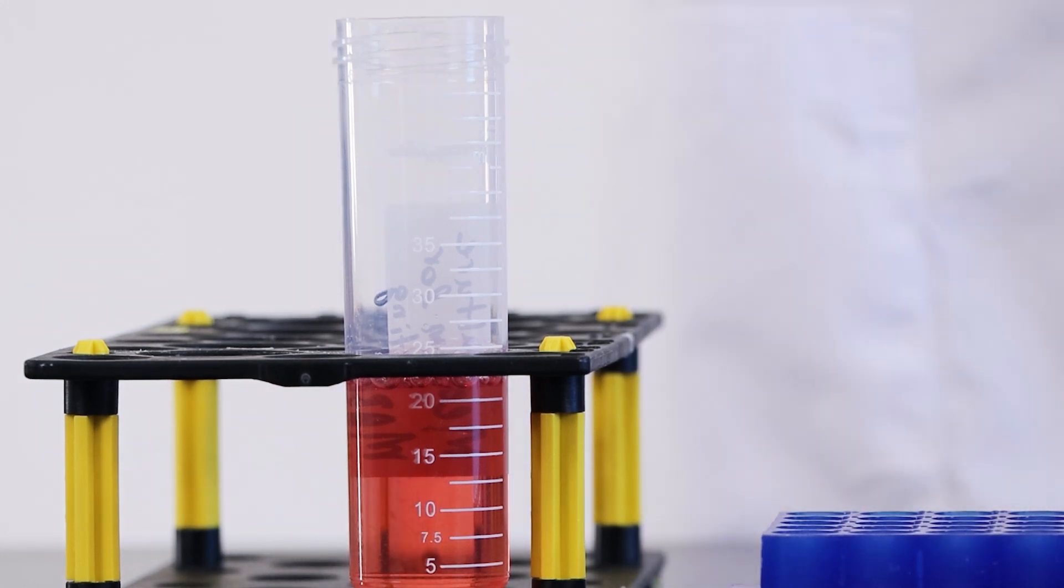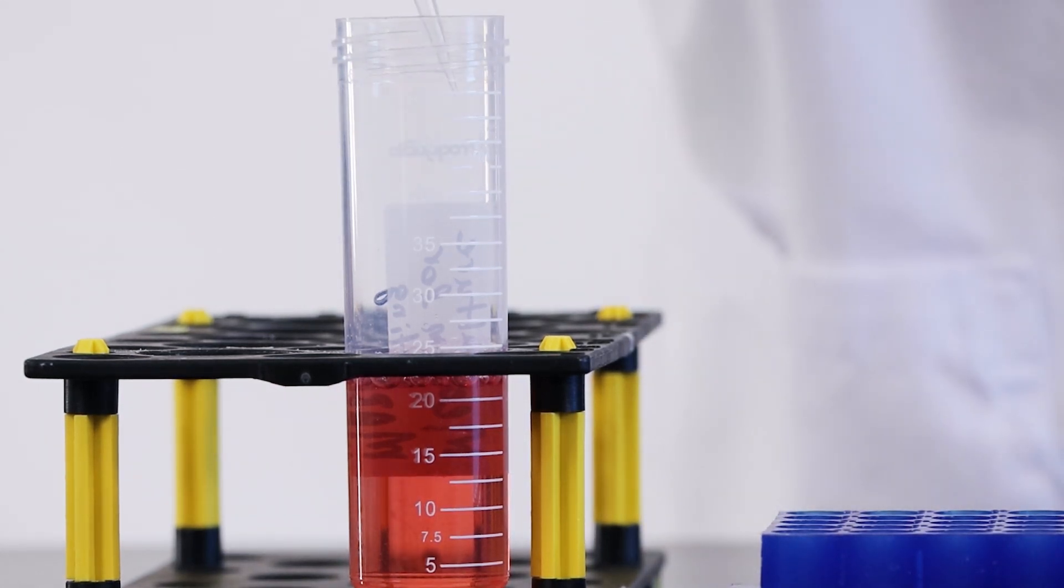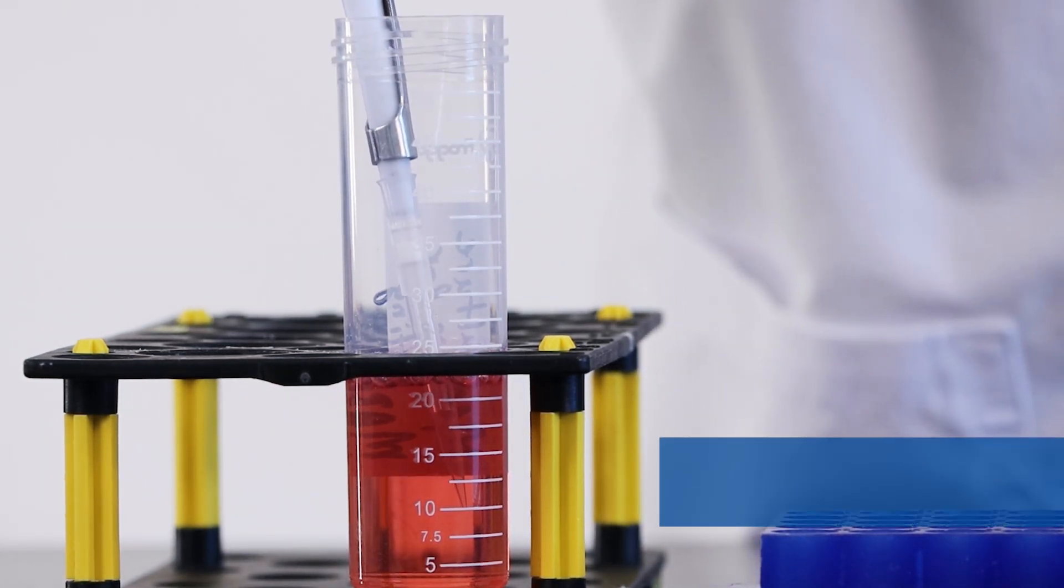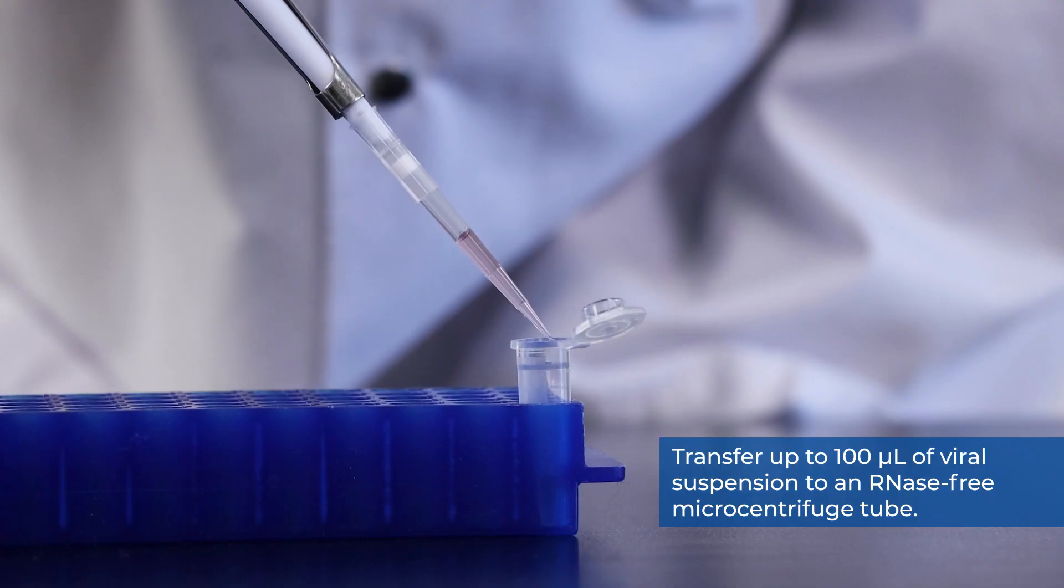Last but not least, we will demonstrate cell lysate preparation from viral suspension. Transfer up to 100 microliters of viral suspension to an RNase-free microcentrifuge tube.